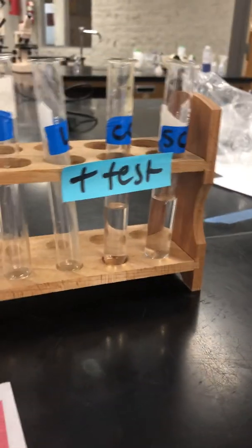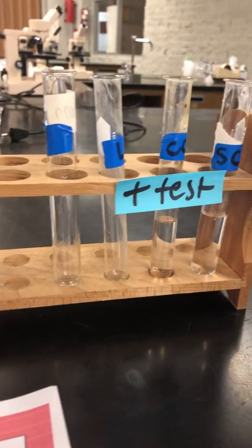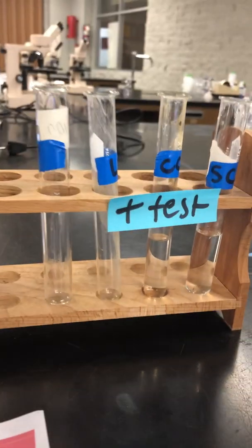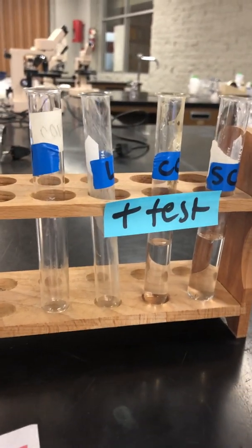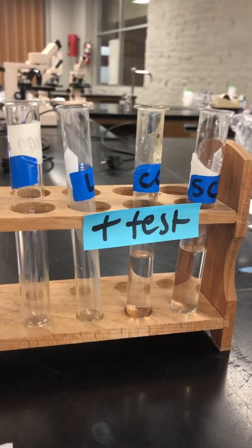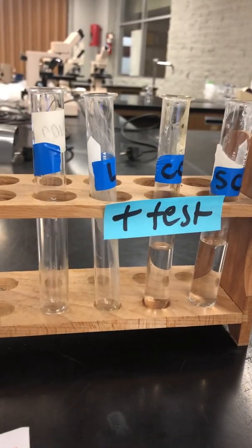And so I'm going to put some of those powders in here and then test them with an indicator to see what a positive result looks like, to see what my solution will look like in terms of color, in terms of texture, in terms of pattern, if I definitely have that macromolecule in my test tube.